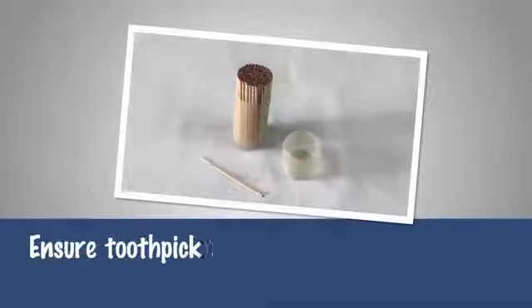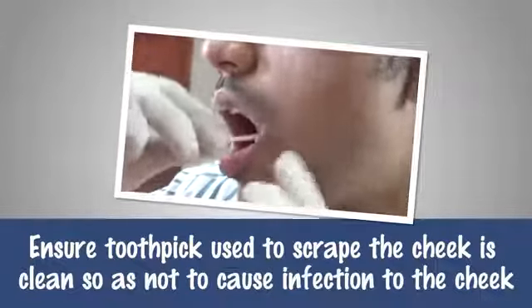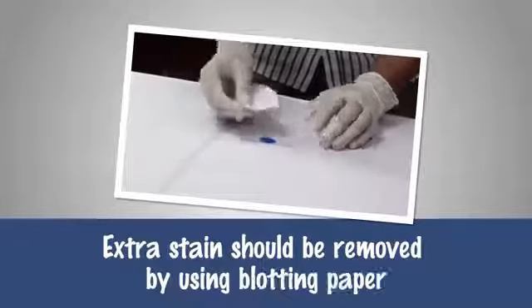Precaution: ensure the toothpick used to scrape the cheek is clean so as to not cause infection to the cheek. Extra stain should be removed by using blotting paper.